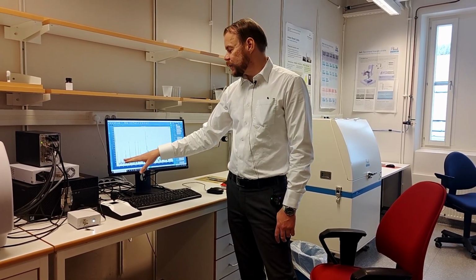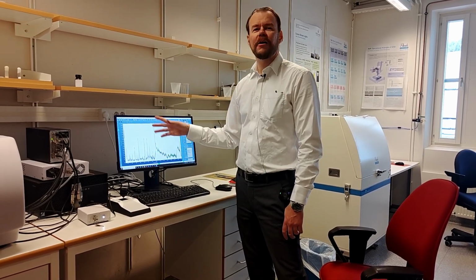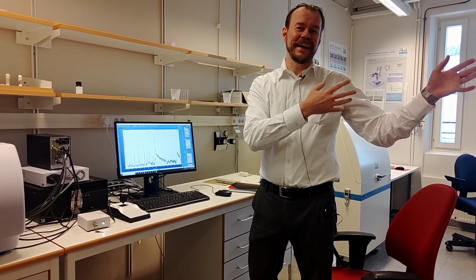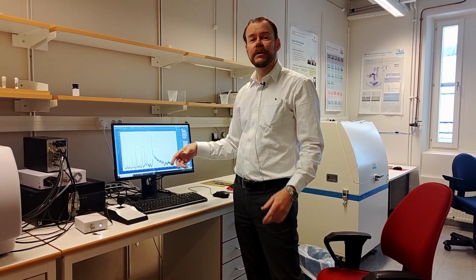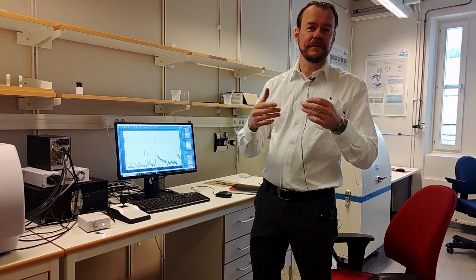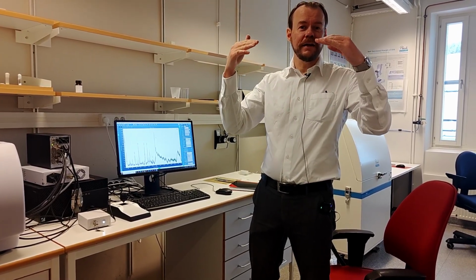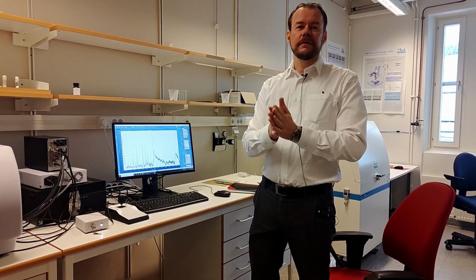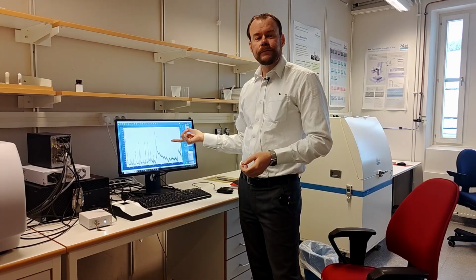But if I want to scan for a long time because I want to have the statistics, how do I do it? This is very similar to the charging problem in the scanning electron microscope. So what you can do is scan for a shorter time, but take multiple spectra. So you scan for 1 second, 1 second, 1 second, and in between you make a pause to let the fluorescence settle. Now we wanted to take spectra for 1 minute.